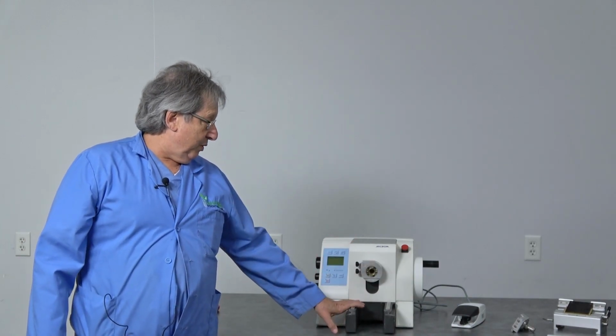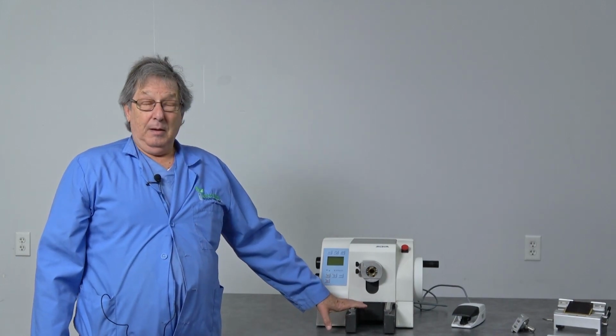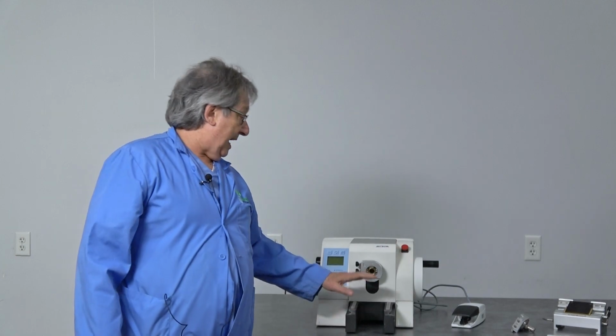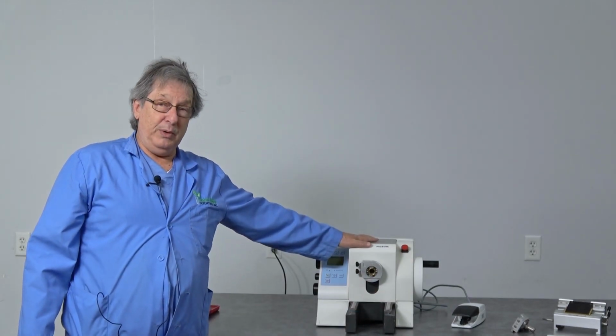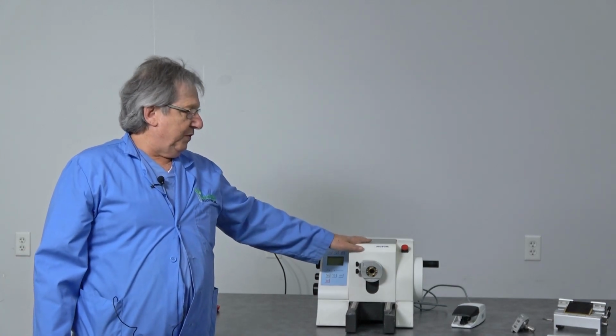Today we're going to show you a Microm that we have coming up. This is under PIR identification number 33818. It has a Microm 355S2. We've had quite a few of these come through here.